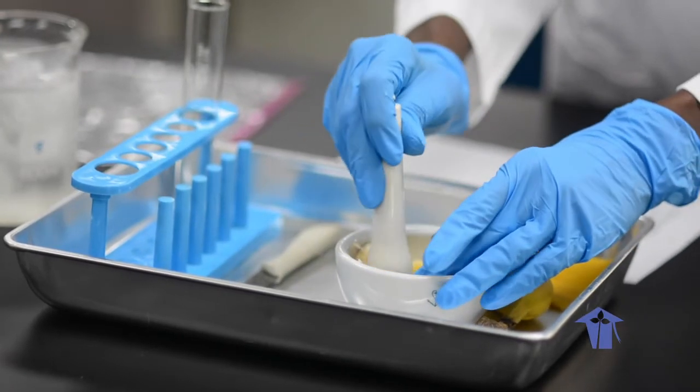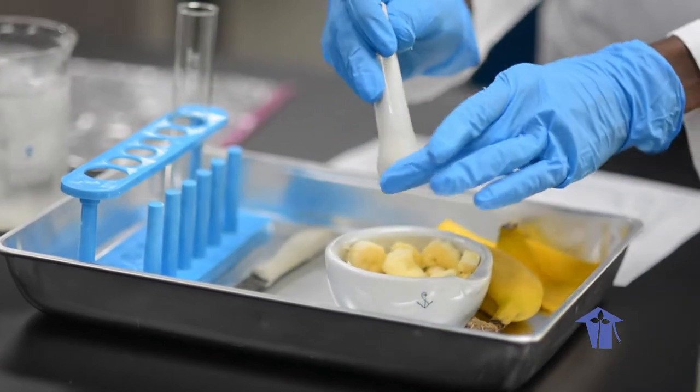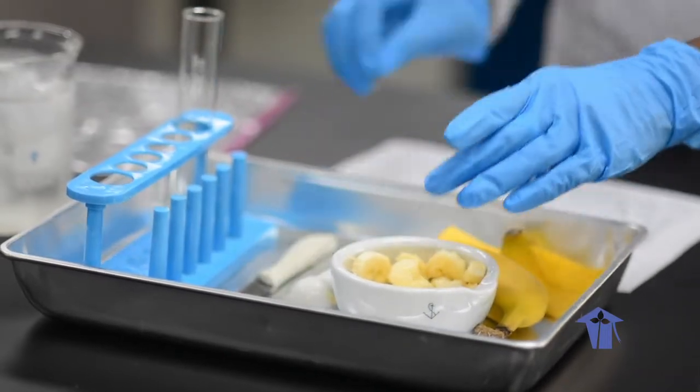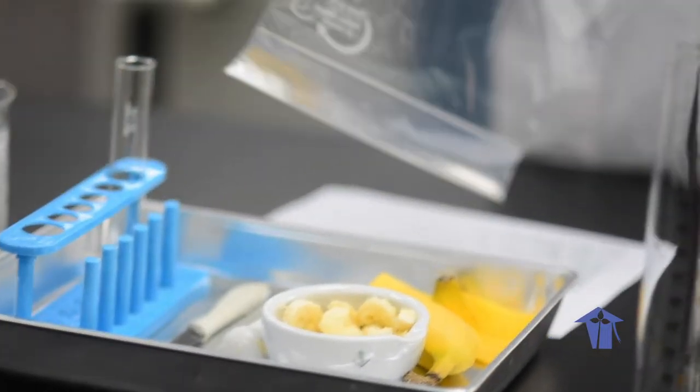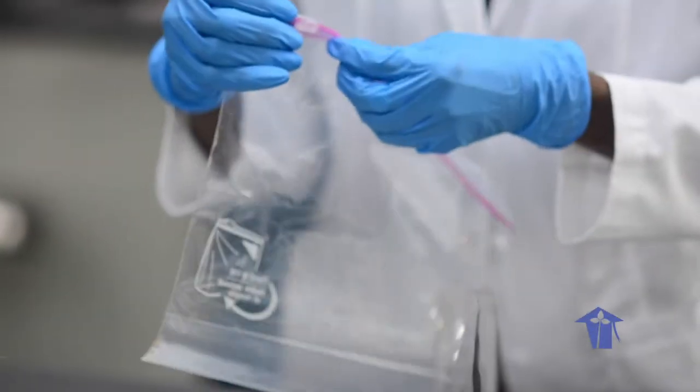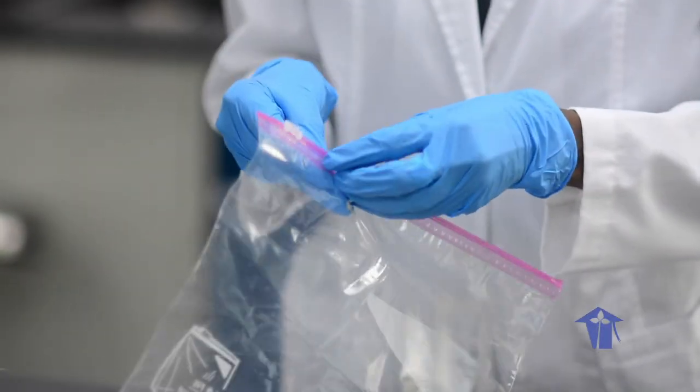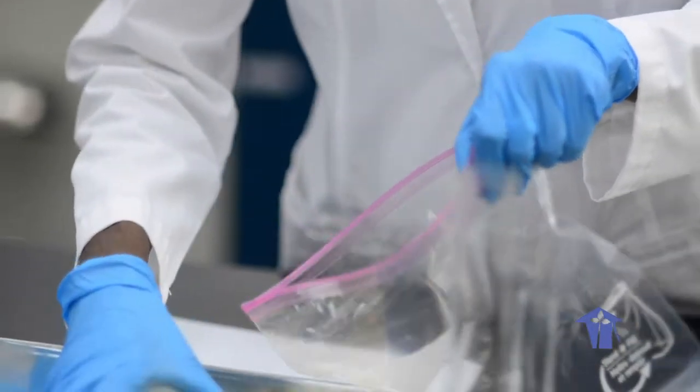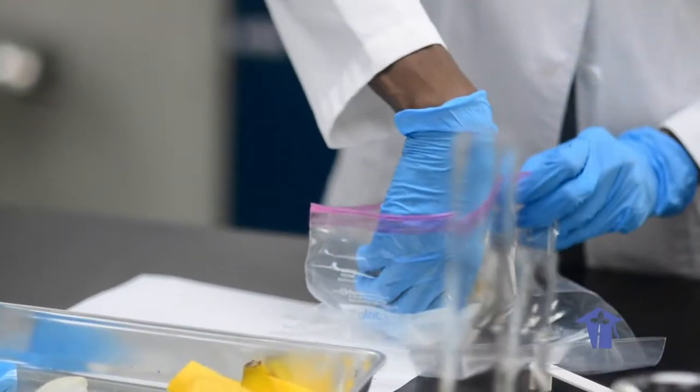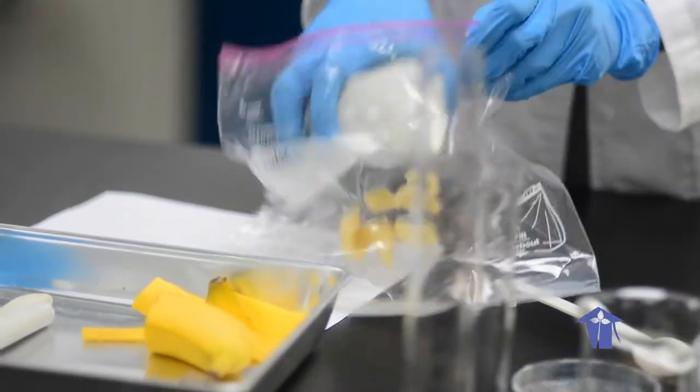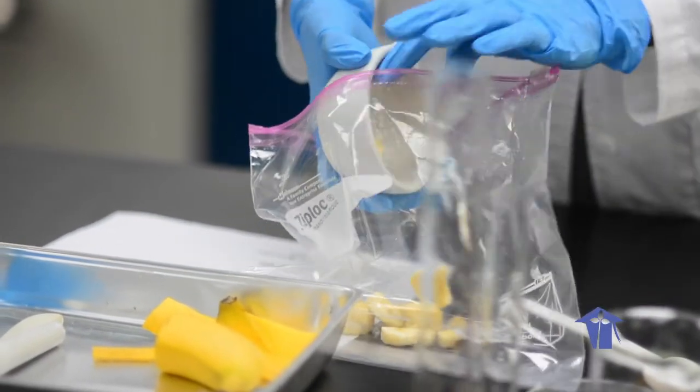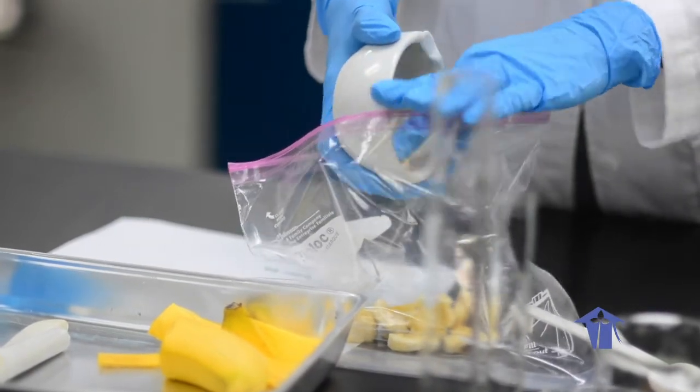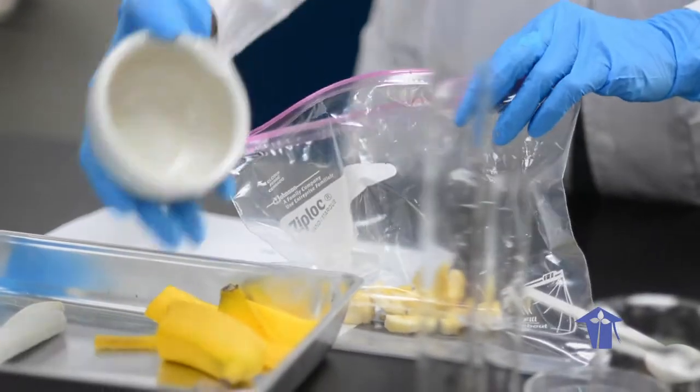If not, what you can do instead, and I will demonstrate for you, is to use a large ziplock bag. For the purposes of demonstrating what you can do at home in the absence of a mortar and pestle, I am going to transfer the banana into this large ziplock bag here.